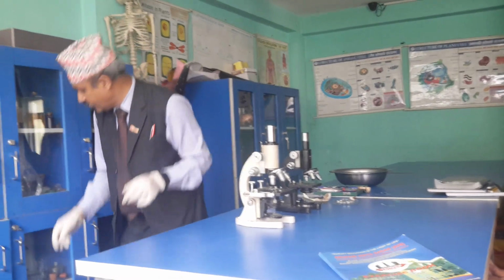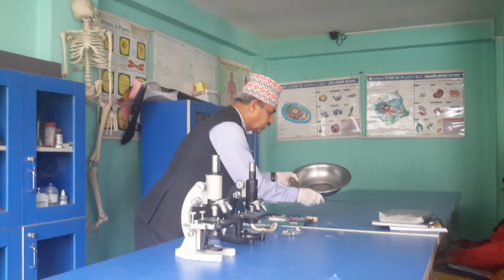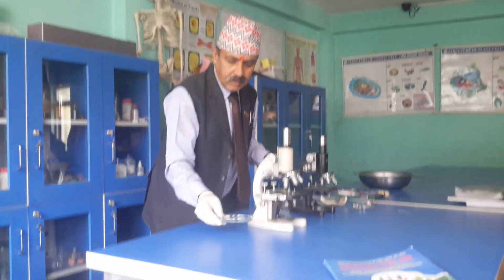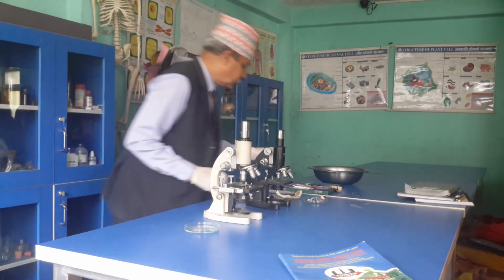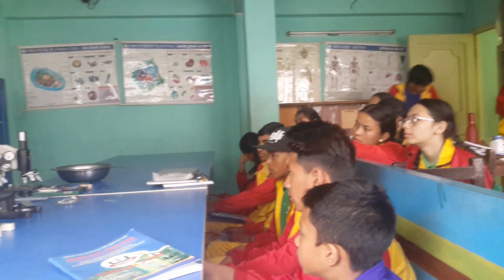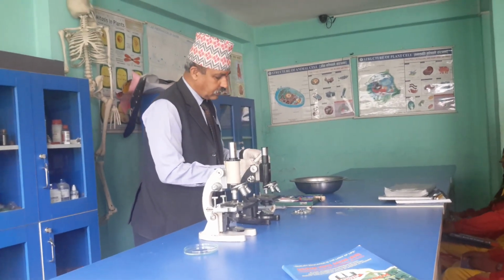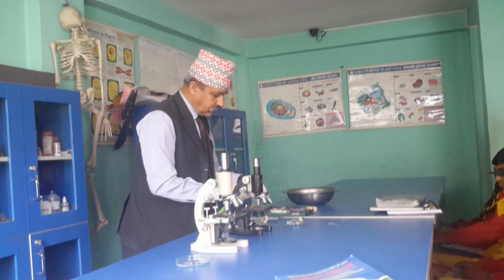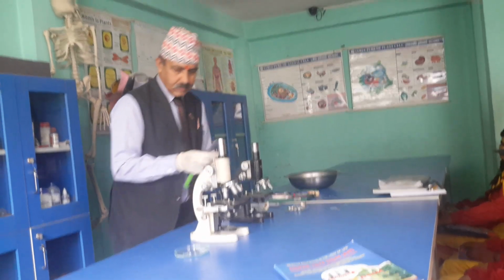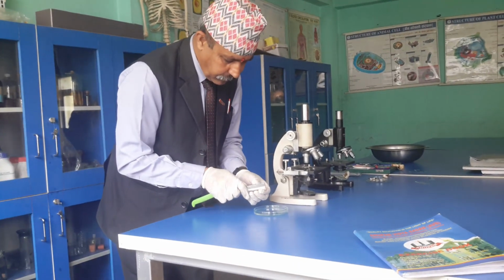Now let me take another petri dish. This part is here next. Okay. Do you remember some of the mushrooms reared in Nepal? They are gobre chao, kanne chao, shiitake chao, and ratu chao or gucci chao, right? I think it is a very easy one. We are just observing the gills only. That's why we don't need this upper portion, right? Gills of this pati chao we are going to observe.